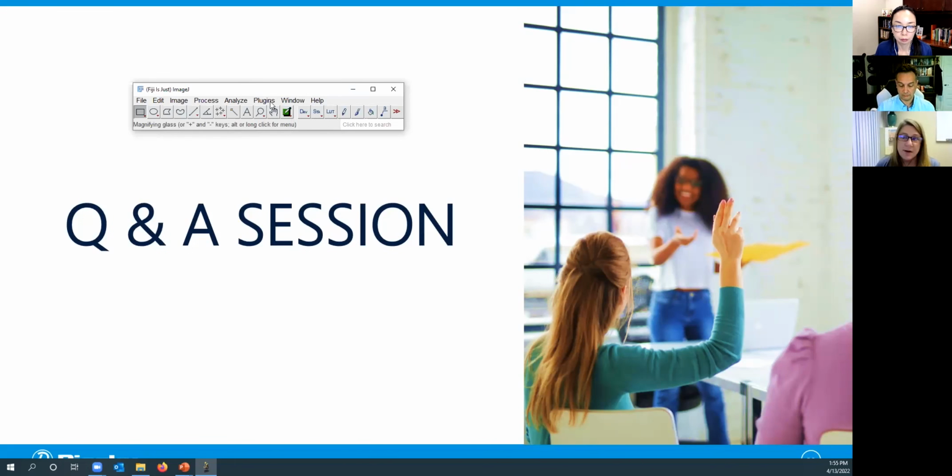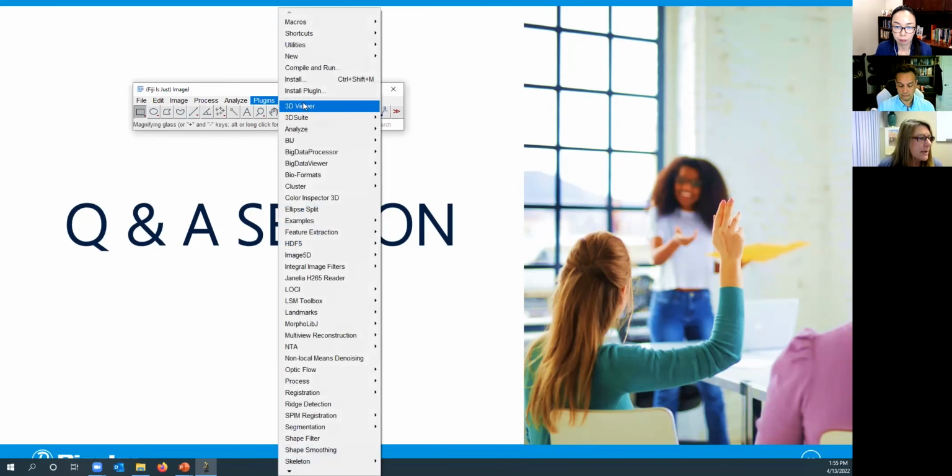Okay, I just want to make sure that I show you where it is in case you want to try it with ImageJ. The great thing is ImageJ is free. There are 3D plugins, a 3D viewer that comes, I believe, with the Fiji distribution of ImageJ. If you click on that, it'll give you a 3D rendered volume of what you've segmented. So you might try that. And then there are some other programs that do really beautiful 3D rendering, and one of those is Dragonfly. Our workshop series will move to that in a couple of months, so we'll show that as well. Perhaps I can touch base with you offline and we can navigate that in more detail as well.